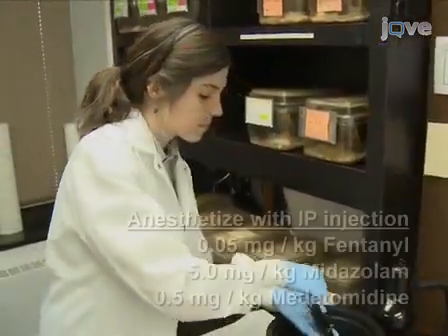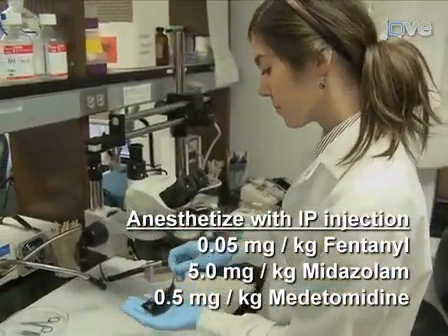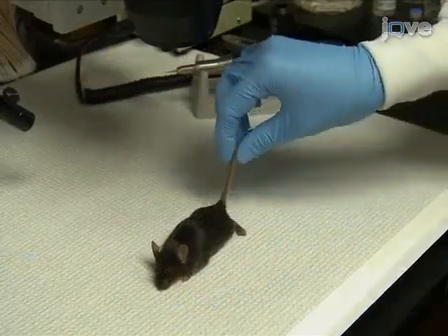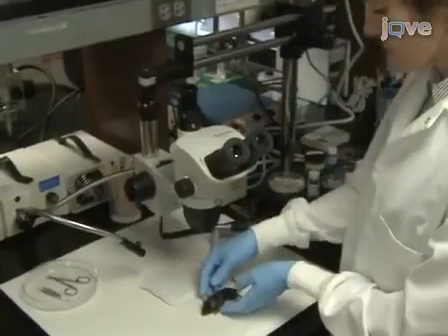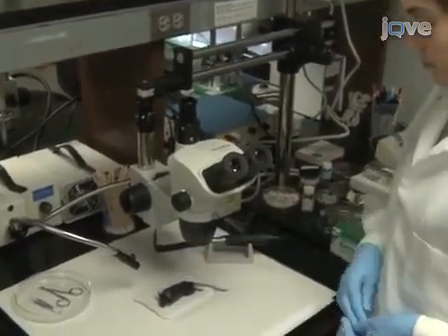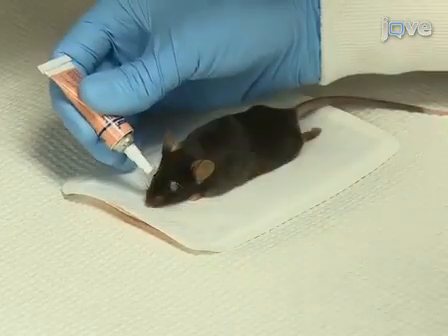Begin preparing a fentanyl midazolam medetomidine anesthetized mouse for surgery. First, ensure that the animal no longer responds to painful stimuli such as a tail pinch. Place the animal on a heating pad to prevent post-anesthesia hypothermia. Then cover the animal's eyes with a protective ophthalmic ointment to keep the eyes moist.